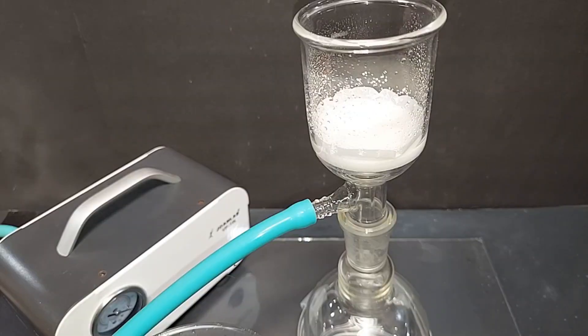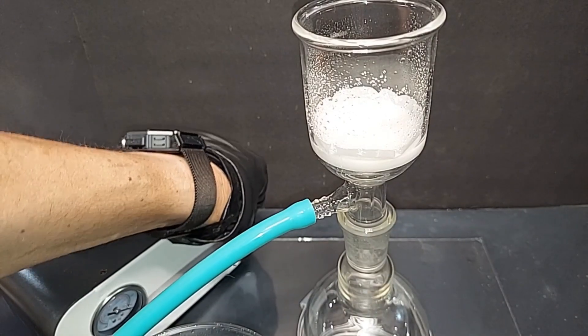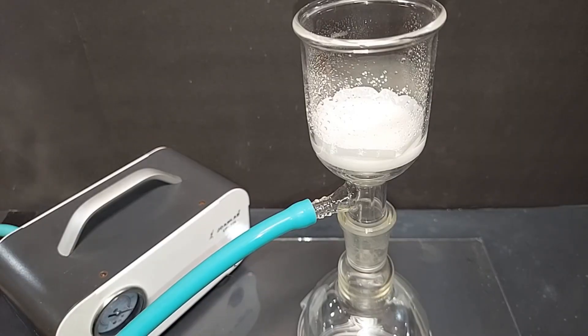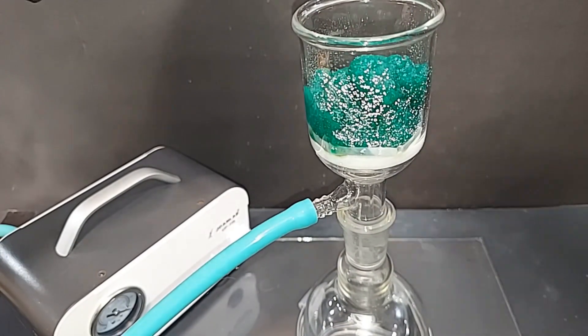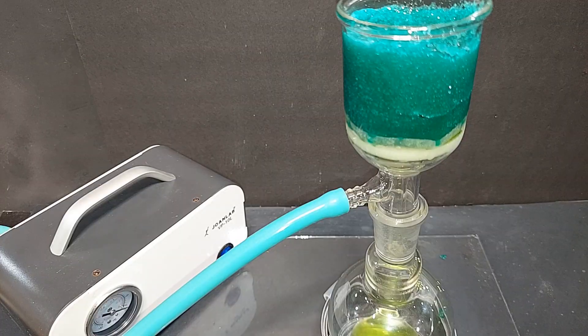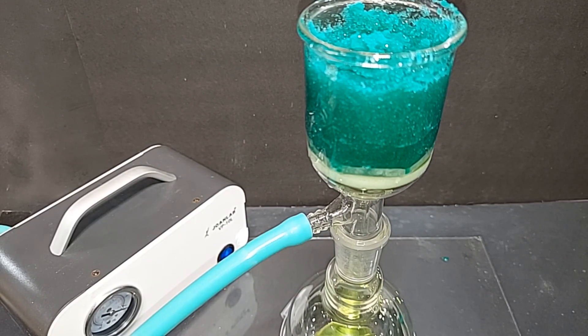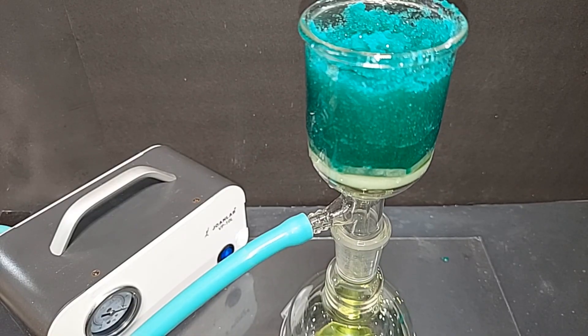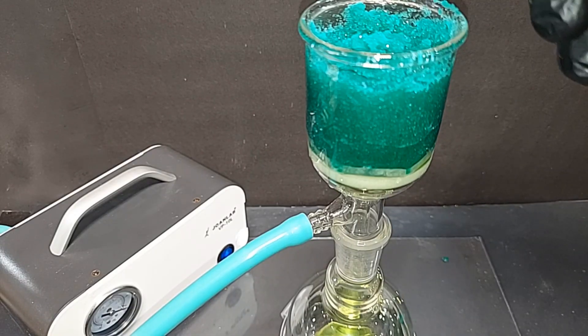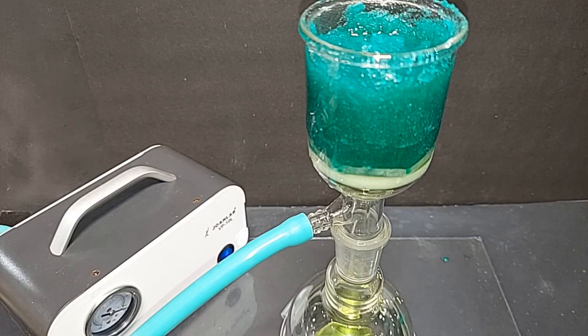All right, ready to go here. What you see kind of sprayed in here is just a little water to get the filter paper to stick better down there. Let's go ahead and start filtering our nickel sulfate. I ran this a little longer than typically because I was afraid there might be frozen pieces in there. I tried to break them down and of course you want those to melt. As I pushed down on the spoon periodically it compressed better and better. Now I'm just going to wash it briefly with some distilled water - this is extremely cold, it came out of the freezer. Not much, you don't want to do too much. I'll let that run through.